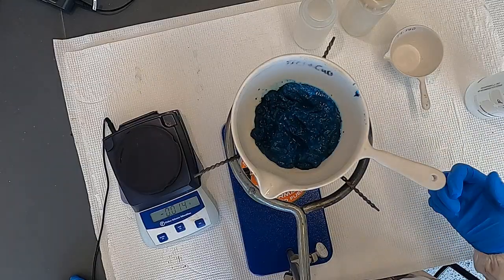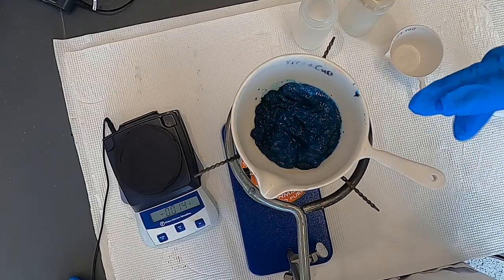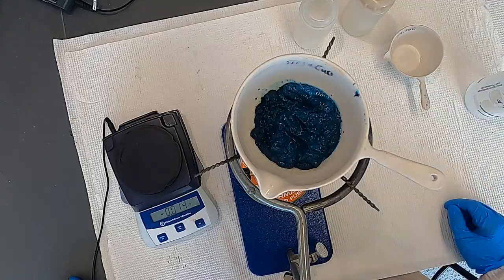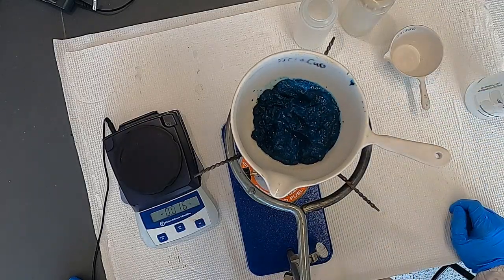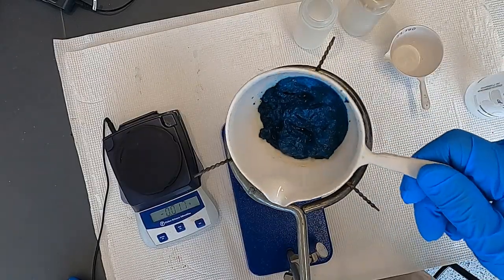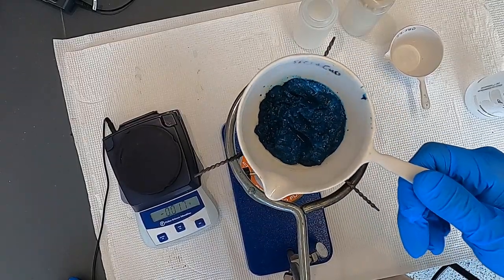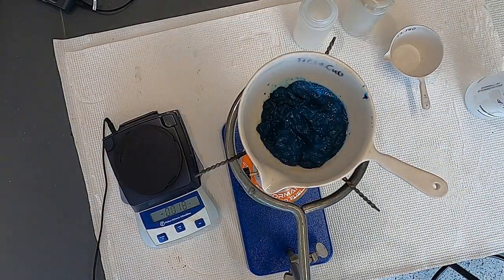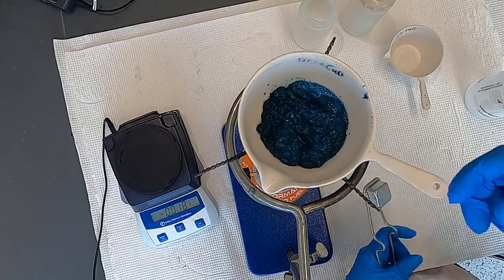So if there were any salts in the solution that I decanted away, they should not be present in this. So now the final step is to heat this over a flame, and it should react. As you can see, it's bluish now, a little bit of a dark blue, and I'm going to heat it over a flame, and we'll get a chemical reaction to finally yield our copper oxide.